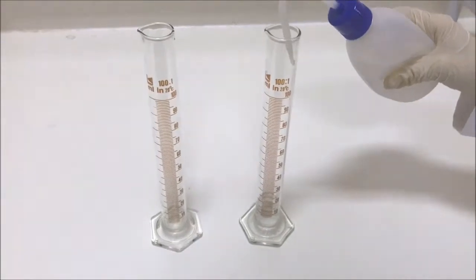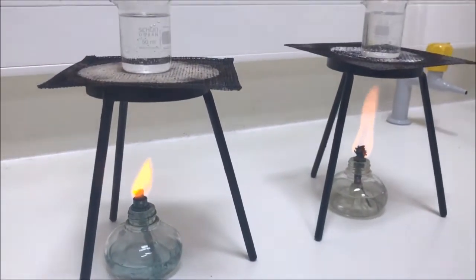Repeat the previous steps since adding the distilled water to the soap mixture 2 more times.